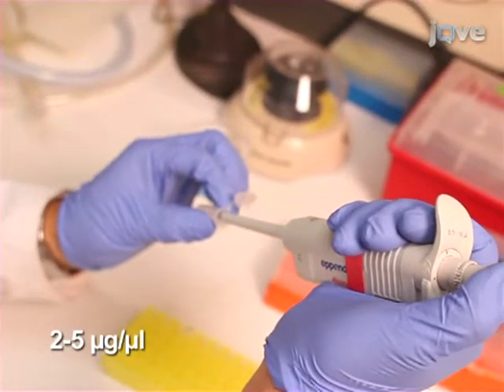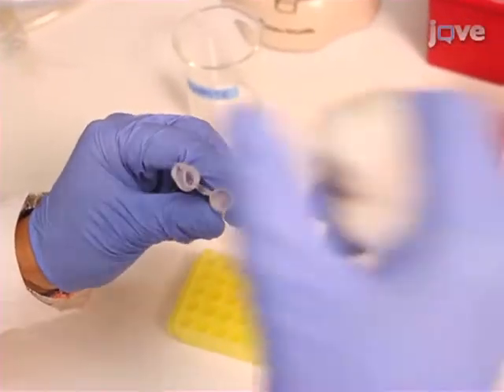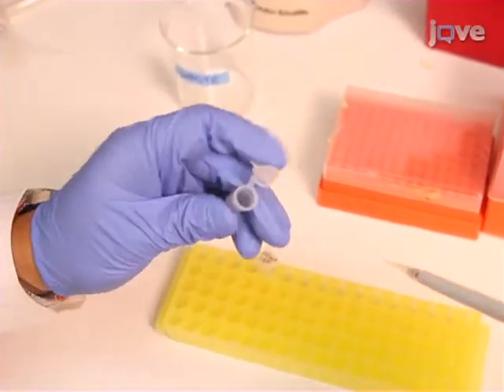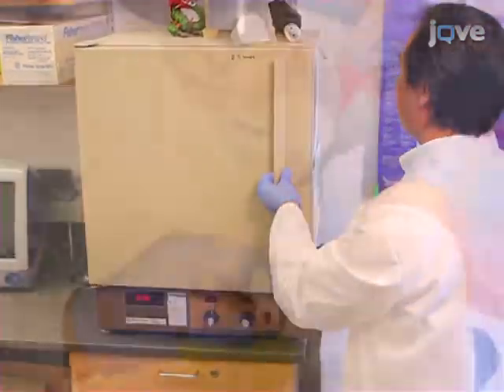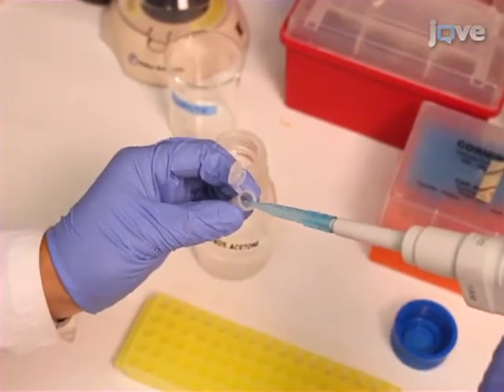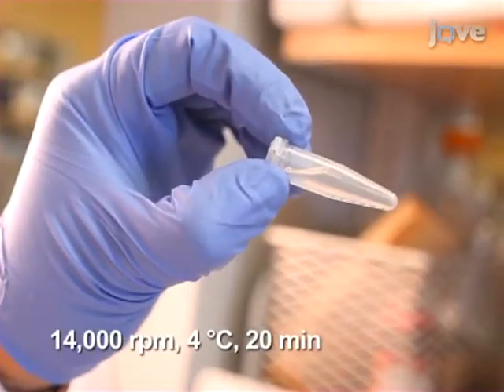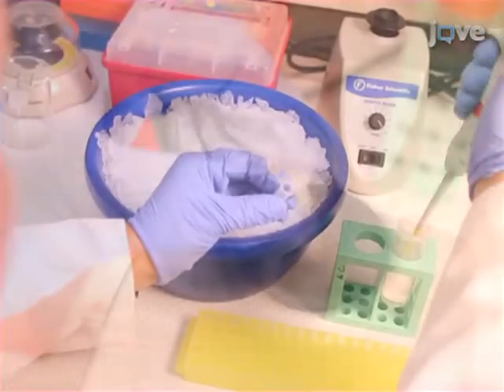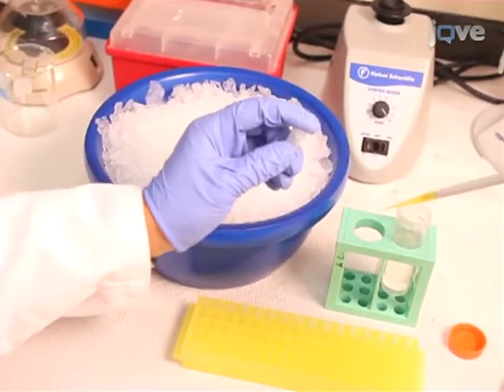For each of the 6 mass tags, start with 100 micrograms of protein sample. Add equal volume of freshly prepared 200 millimolar iodoacetamide alkylation buffer to block the free thiol groups. Incubate at 37 degrees Celsius for an hour. Then, to precipitate the proteins, add 1 milliliter of cold 80% acetone and place at -20 degrees Celsius overnight. Pellet the protein by centrifugation and perform 3 washes with 80% acetone. After air drying samples on ice, resuspend the pellet in 50 microliters of lysis buffer.